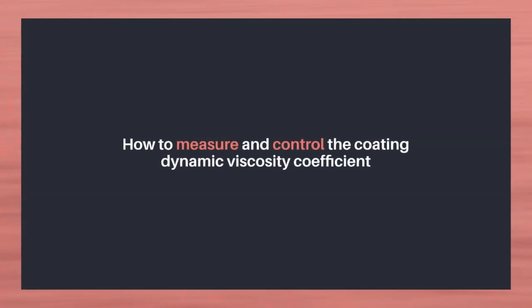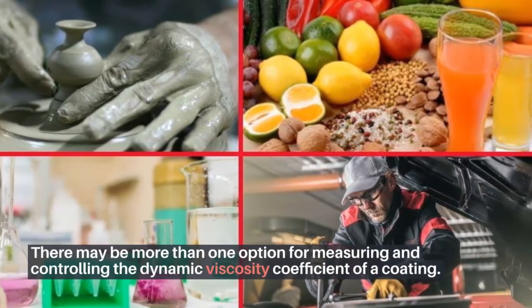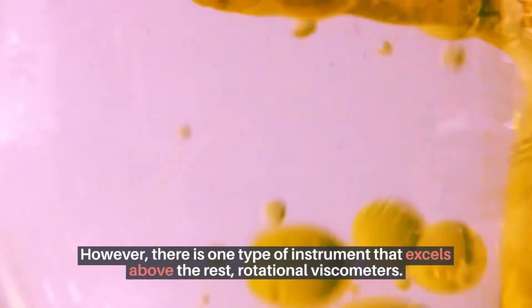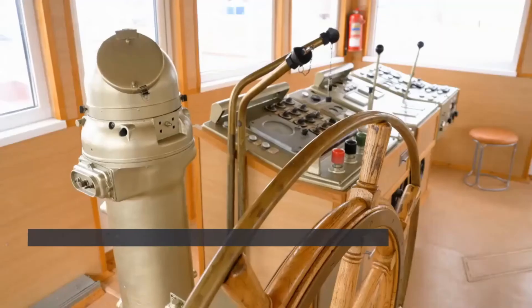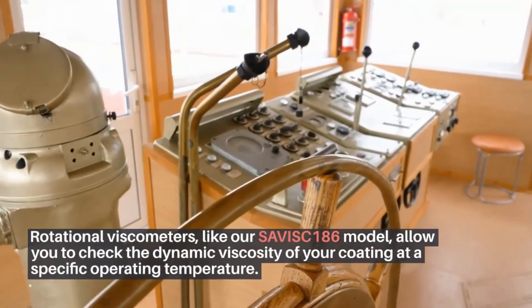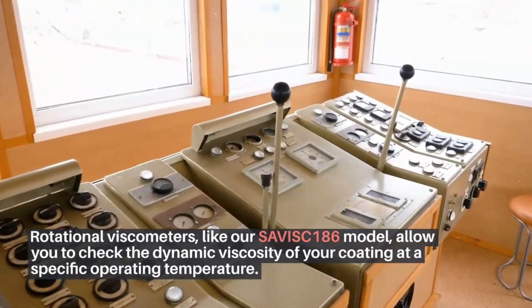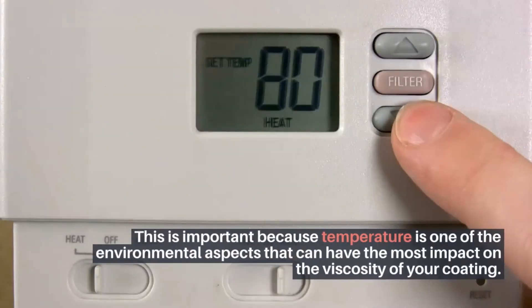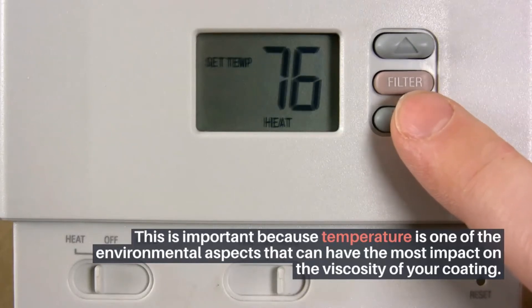How to measure and control the coating dynamic viscosity coefficient. There may be more than one option, however there is one type of instrument that excels above the rest: rotational viscometers. Rotational viscometers, like our SAVISC 186 model, allow you to check the dynamic viscosity of your coating at a specific operating temperature. This is important because temperature is one of the environmental aspects that can have the most impact on the viscosity of your coating.